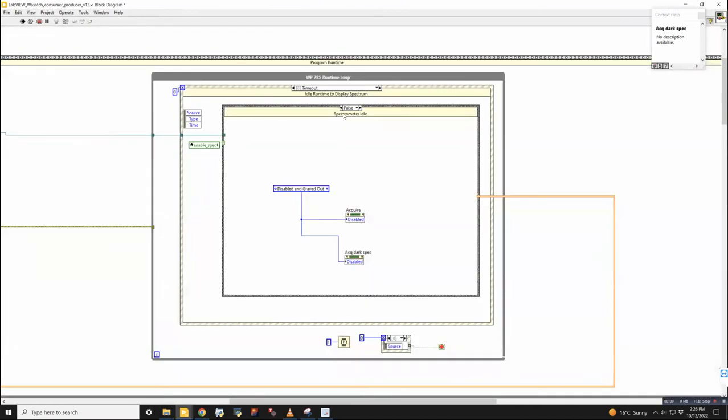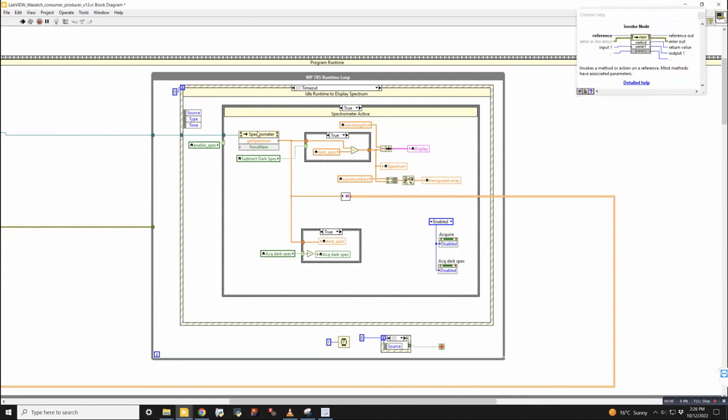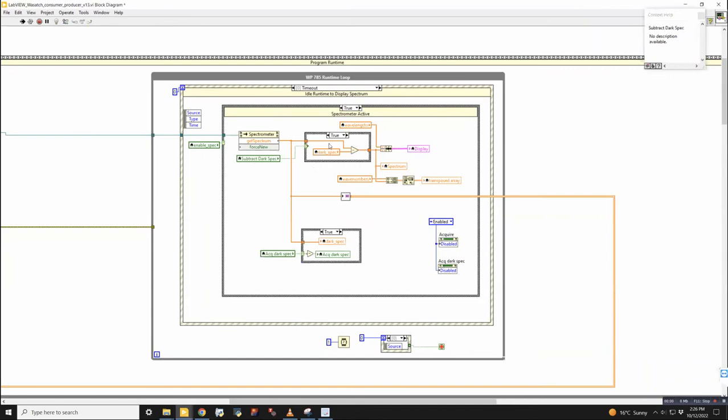And then as soon as I re-enable it, what it's going to do is make sure that these buttons are enabled. It will get a spectrum from the spectrometer and has a couple things here. So the first thing it will check for is if subtract dark spec is enabled over here. So if it is enabled, what it will do is subtract the dark spectrum from the spectrum it just read and pass that out to the next processing. If it's false, then it won't do anything.